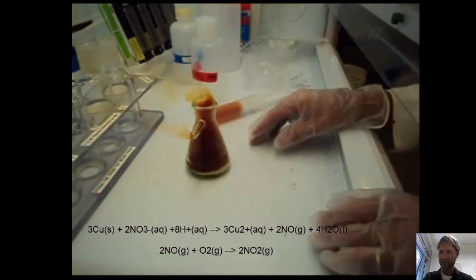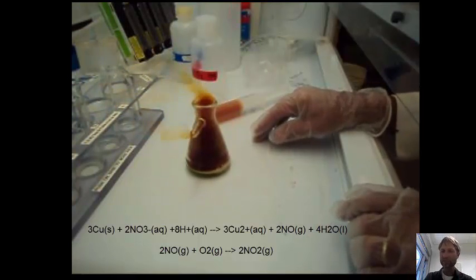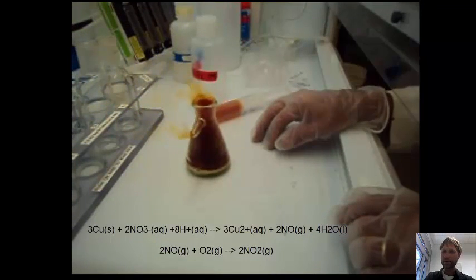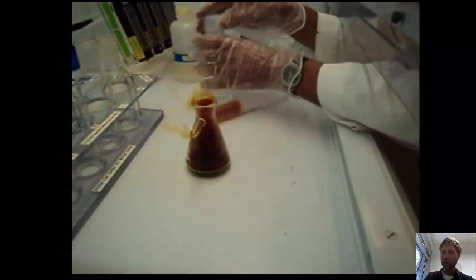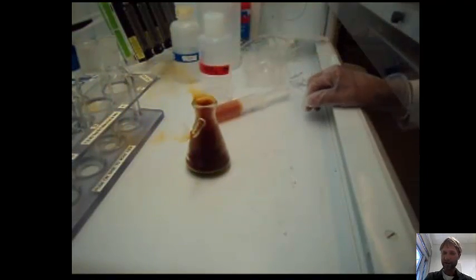Okay, so now I'm taking the cap off. I've gotten my syringe full of NO2, and you can see that it's boiling and giving off gas. The reaction is quite exothermic and happening rather vigorously.